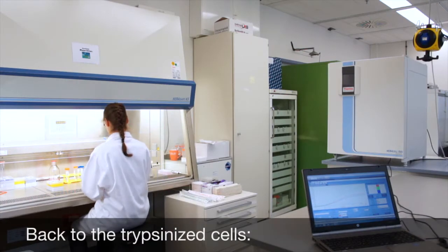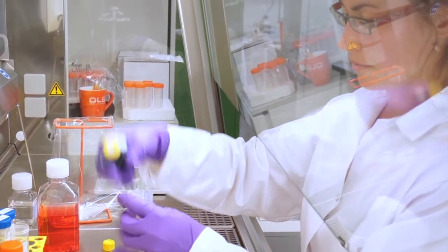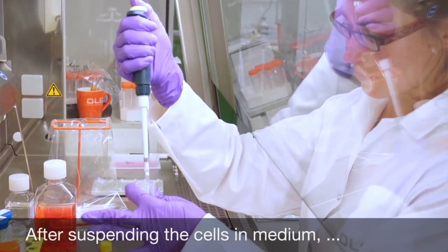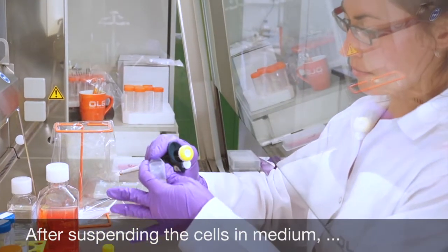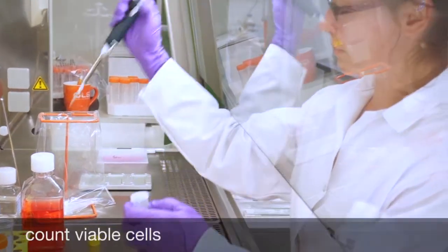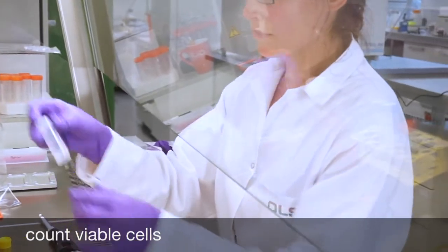Resuspend the cell preparation and determine the number of viable cells. Precise counting of your sample is a crucial point that will determine the quality and reproducibility of results.